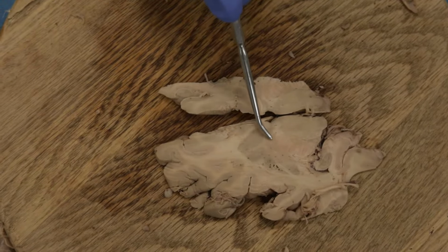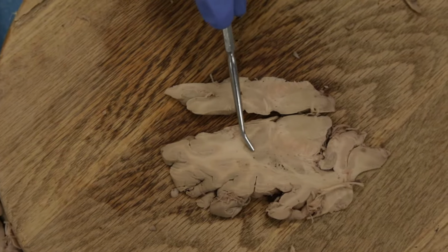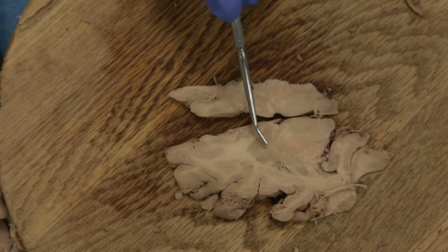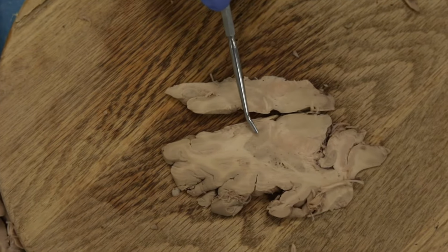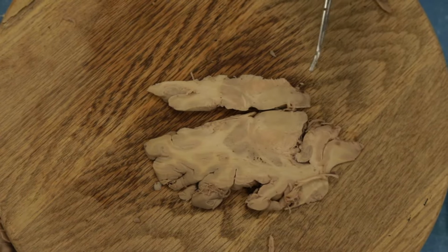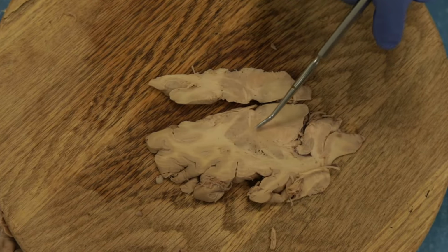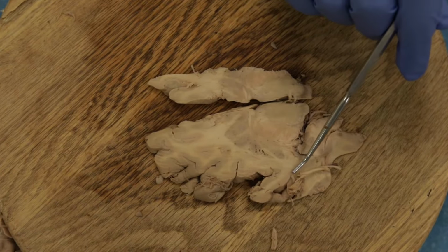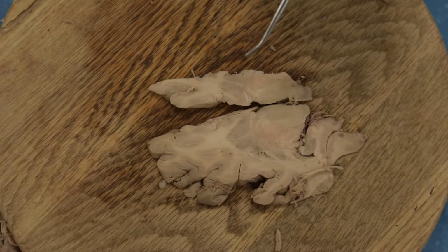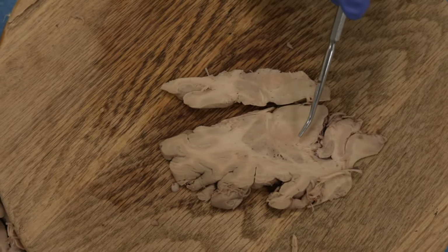So this is just a little bit that's left of the anterior commissure. I'm sorry, the anterior limb of the internal capsule. Here's the anterior commissure. Okay, so what is medial to the anterior limb of the internal capsule? We're still seeing some of the caudate here, and then the putamen is out lateral. So if we kind of follow the anterior commissure back and kind of imagine this going to the temporal lobe out here, crossing over, communicating with the opposite temporal lobe. All right, so this is probably cerebral peduncle.